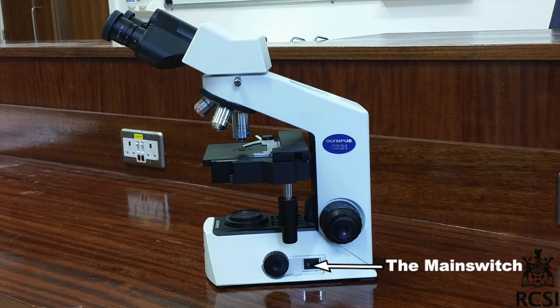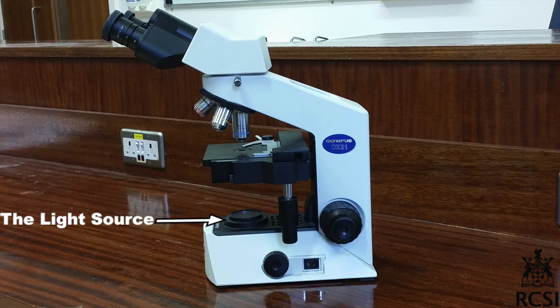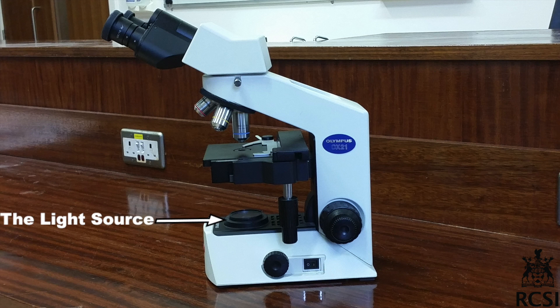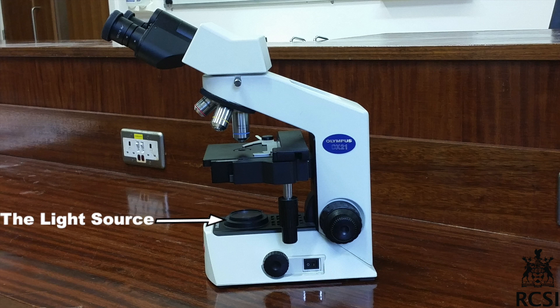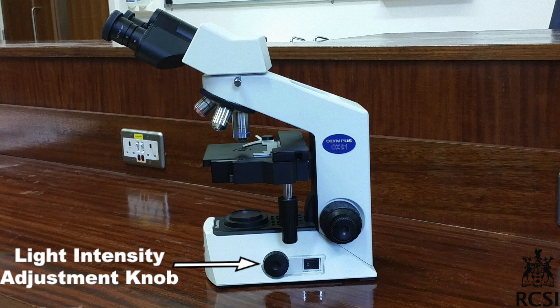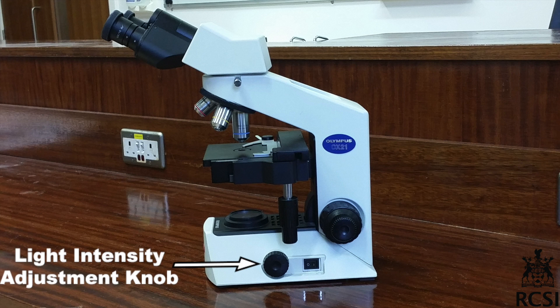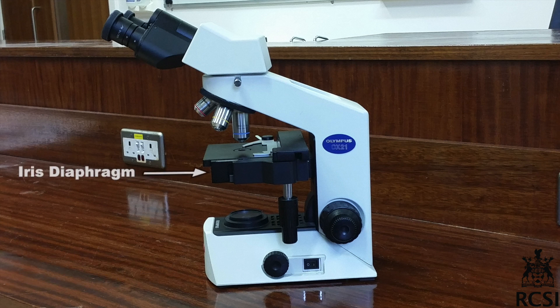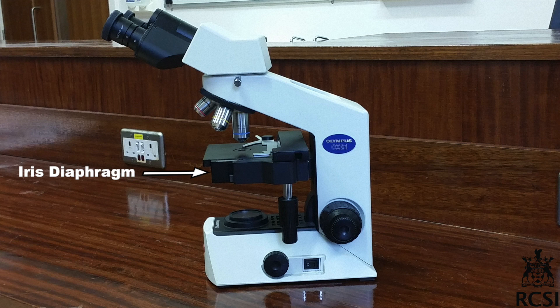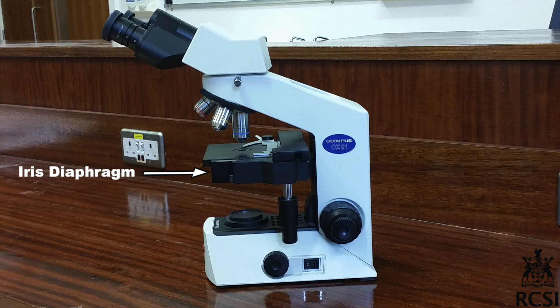Use the main switch to turn the light on or off. The light source shines up through the stage to focus the light on the slide. The light intensity adjustment knob is used to change the power of the illumination on the slide. The iris diaphragm is located underneath the stage and controls the amount of light that reaches the objectives.